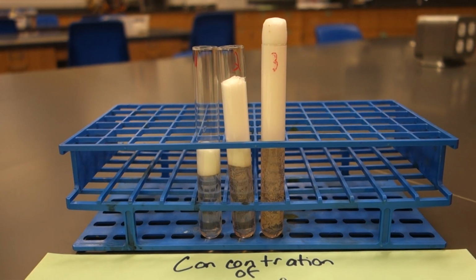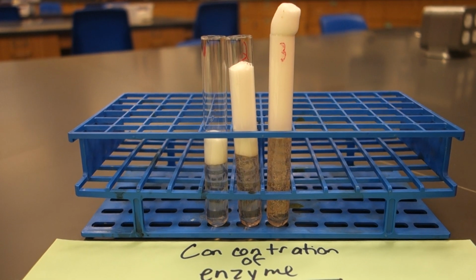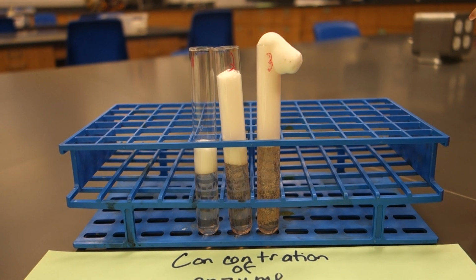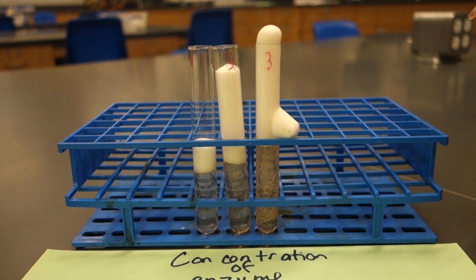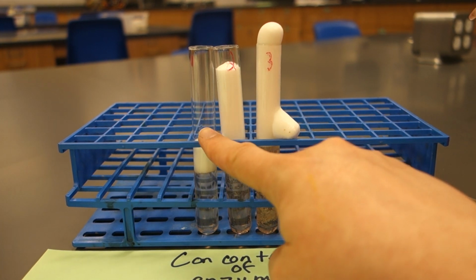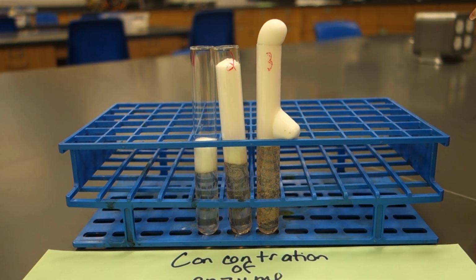And it's totally going to overflow. I'm just going to keep going up to see how far it goes. Over time, if I were to let this sit for, say, an hour, eventually all the test tubes would produce the same amount of bubbles of the oxygen product because enzymes are reusable. So even though test tube 1 only has 1 milliliter of enzyme in it, it's still able to go over and over again, which means eventually test tube 1 would have the ability to make just as many oxygen bubbles as test tube 3. The difference is, test tube 3 is just able to do it faster.